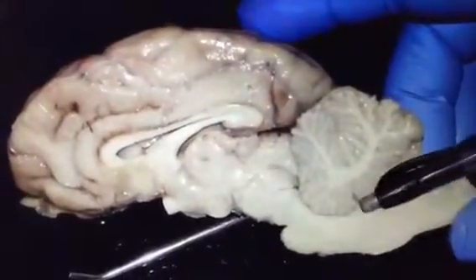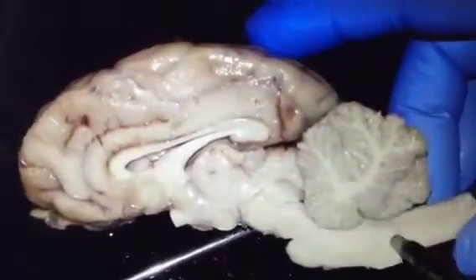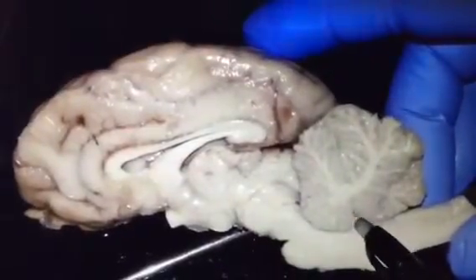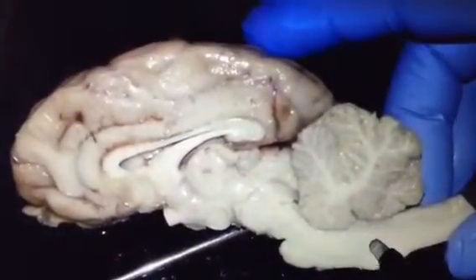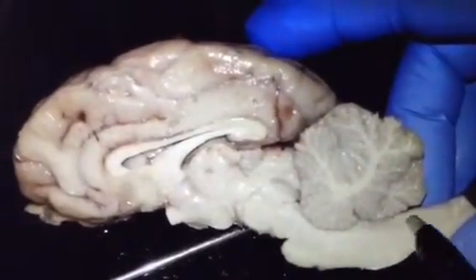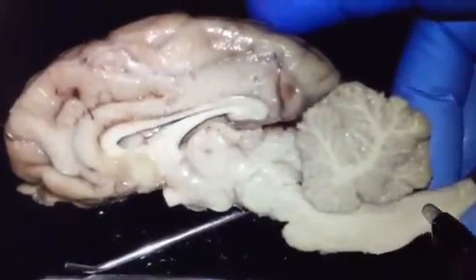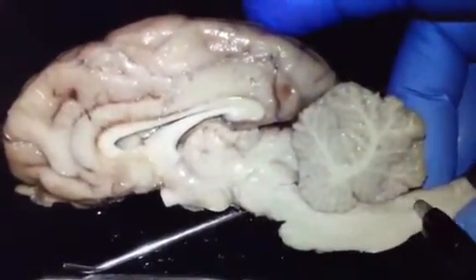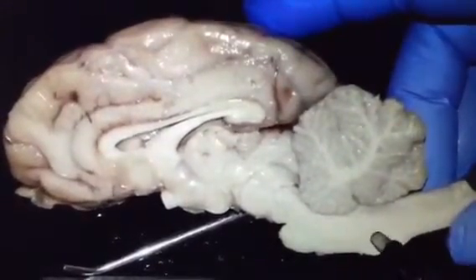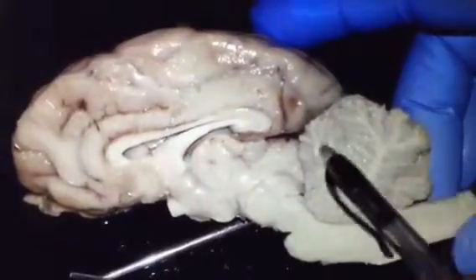Now right above the medulla oblongata, here we can see the little black gap, which is called fourth ventricle. The fourth ventricle is continuous with the canal that runs down the central spinal cord, which is called central canal. Here is the little black thin line, which is called the central canal. Spinal cord with the central canal, medulla oblongata, fourth ventricle, and this portion is called cerebellum.